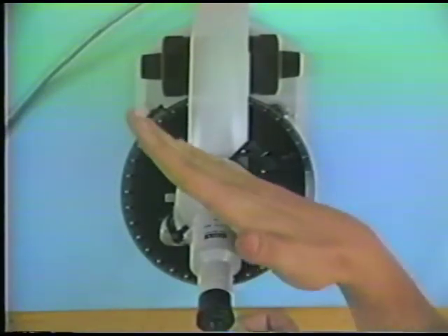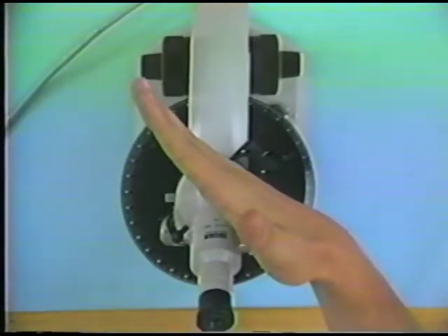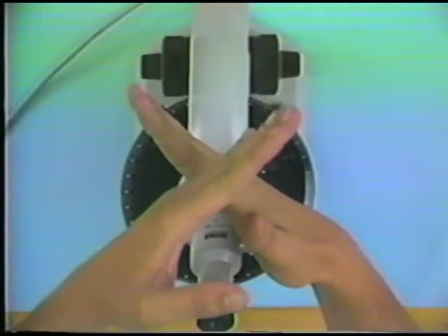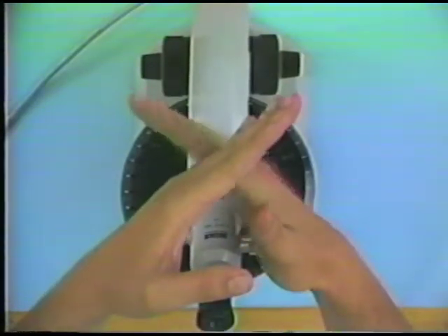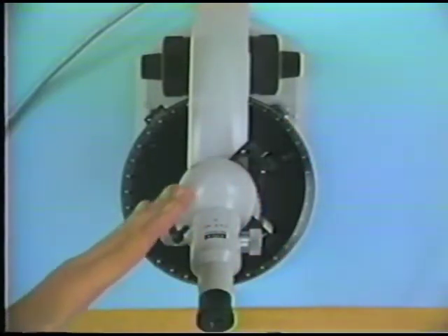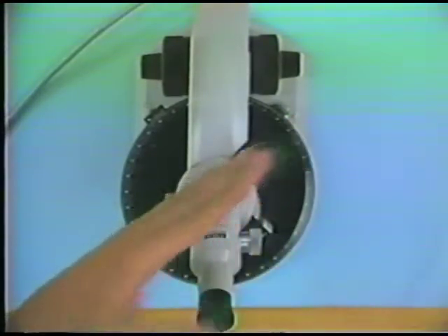That is, being inserted in this direction. And the slow ray in the accessory plate, this particular one, is across the accessory plate. This means that the slow ray in the accessory plate, in this particular case, has this orientation.